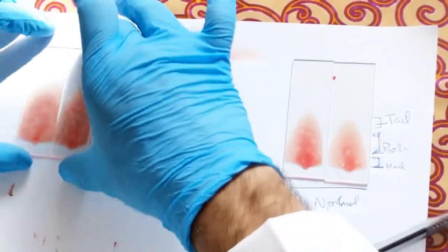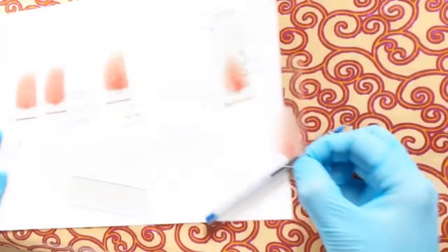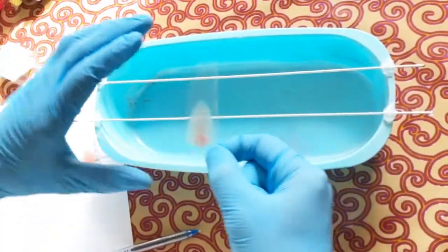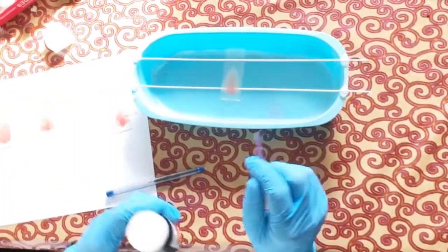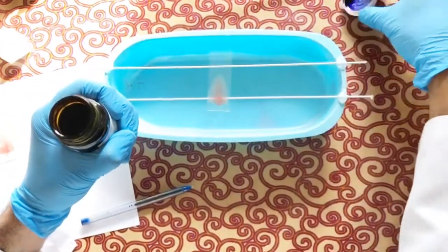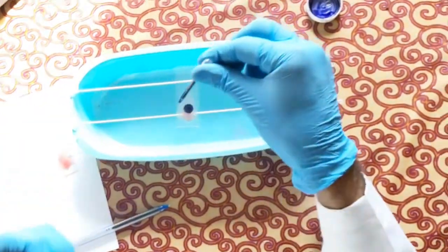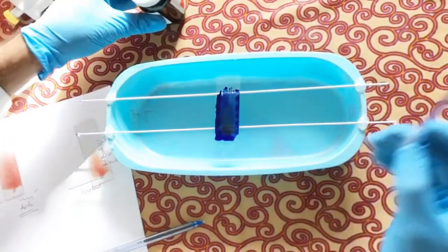Once all smears are prepared, we must ensure they are completely dry. The slides still wet here should be air-dried or dried with a dryer. After complete drying, we move to the staining step. For staining with Leishman stain, I take a dry slide and cover the smear with around five to six drops of Leishman stain — which contains all necessary reagents for differential and RBC/platelet staining — and leave it for two minutes.